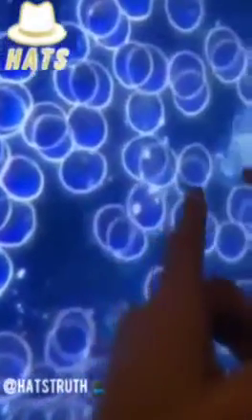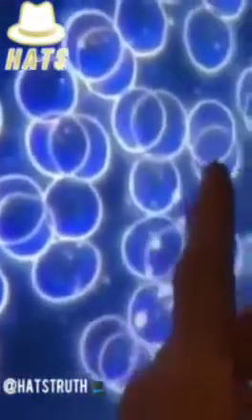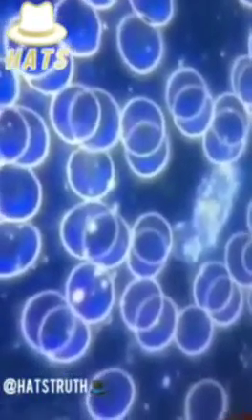Let's look at this live. This is what blood cells are supposed to look like. A white blood cell, you see the activity, right? And the membrane is the way it's supposed to be. If you look, it's perfectly circular. This is the visual reference for how good blood cells should look. Here we're seeing a totally corrupted cellular membrane.